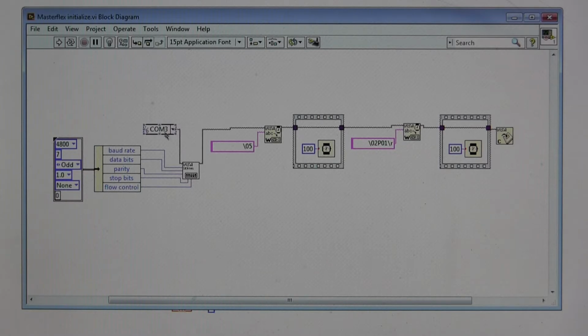Now, once COM3 is set, that is sent over to this write command, and here we have our first little string of command that is sent to the pump, the \05. \05 is the inquire character, and it basically tells the pump that the computer wants to communicate with it. It wants to ask it something or tell it something. So now, after receiving this, the pump sort of wakes up and becomes ready to receive more instructions.